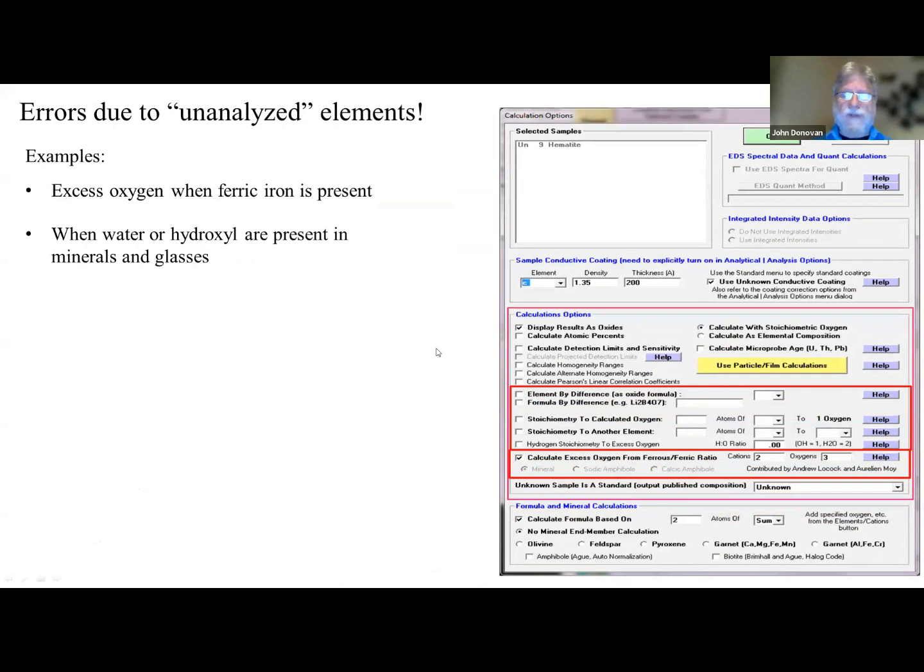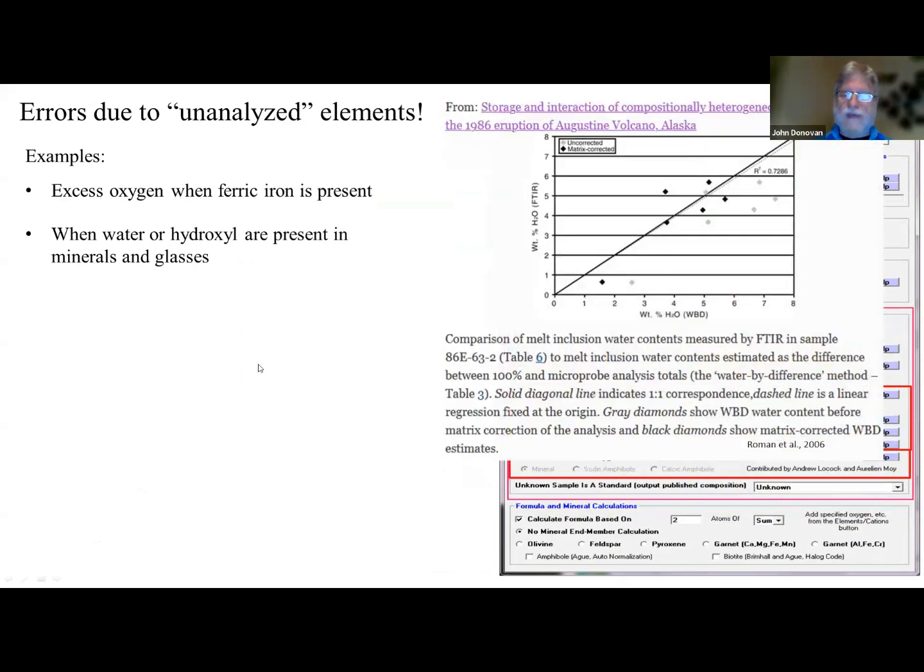These can be corrected for now using charge balance in PFE, which is really cool. There's a paper that just came out on that. This is an example of not including water in a glass analysis when comparing FTIR to microprobe. The gray symbols are without water in the matrix correction, and the black symbols are water in the matrix correction. So as you can see, you're going to overestimate the amount of water by microprobe if you do not include water in matrix correction.